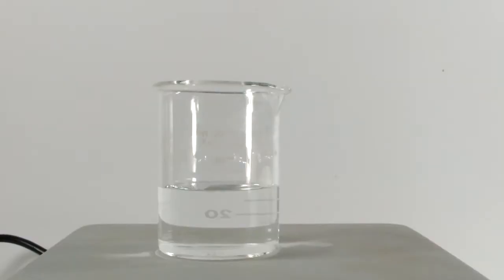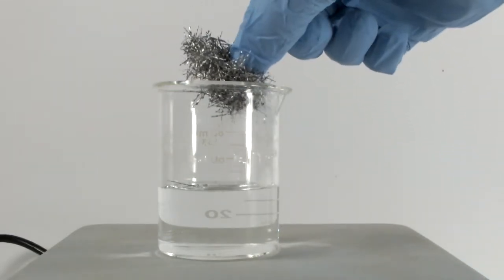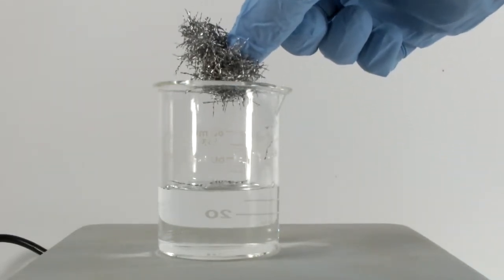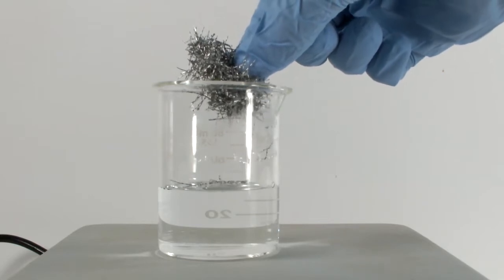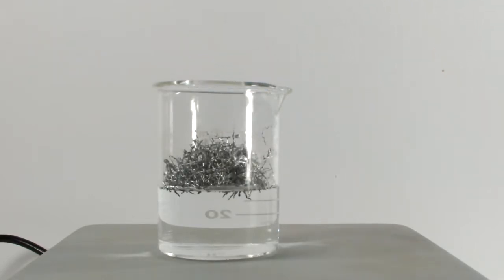Okay, here's another 50ml portion of lead nitrate. I ordered some magnesium turnings from eBay a couple years ago, and I'm pretty sure they're a magnesium alloy. I burned a few pieces, and they do burn, but much slower than pure magnesium. Anyway, I suspect it's magnesium aluminum, and both of those should replace lead, so it's not a big deal in this reaction.